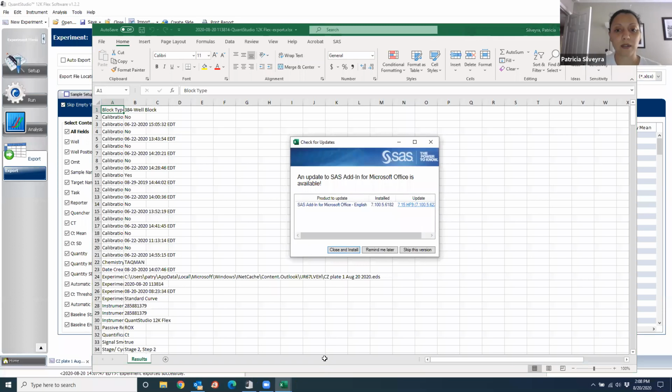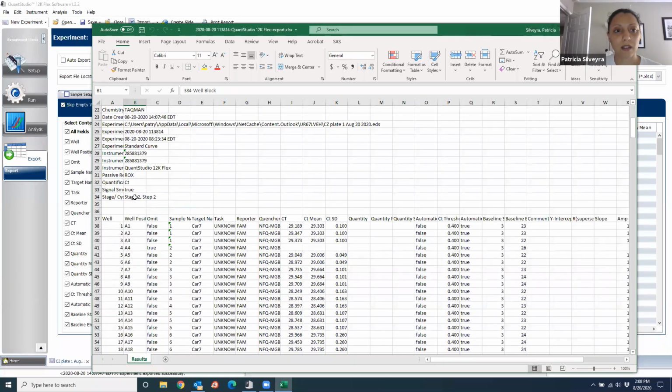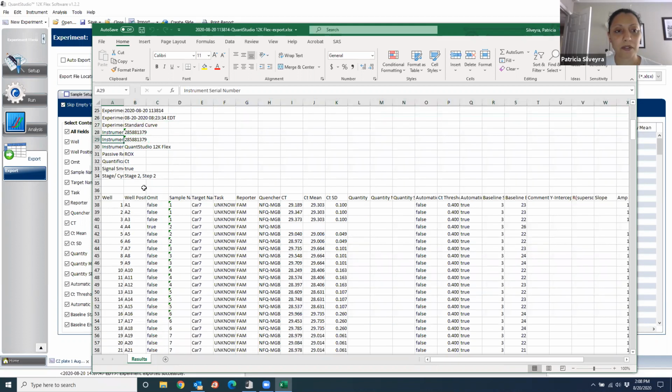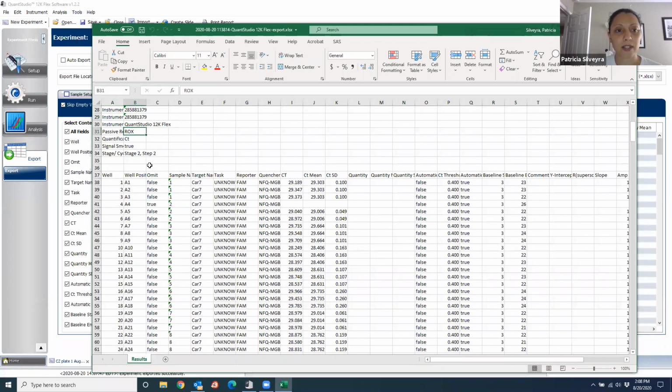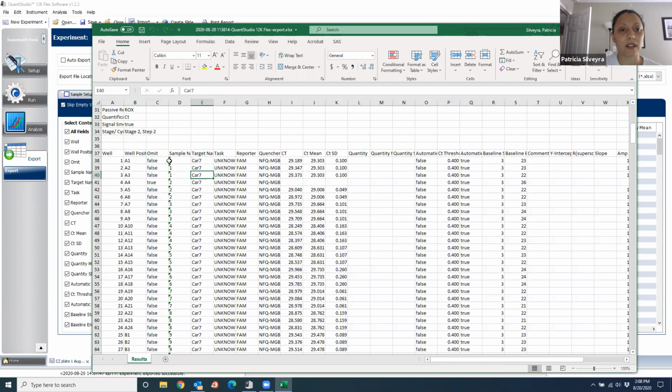All right, so here's how it looks as Excel. It's going to tell you what you ran, when you ran it, the different calibrations. See, these are all the calibrations I did. This is the experiment: when it was run, the number of the instrument, what was the passive reference, and your protocol too, just in case you have to go back at any time. And then here it tells you the well position, with the sample, and the CT value.